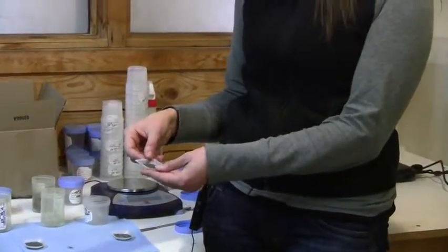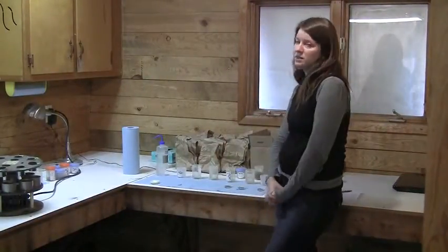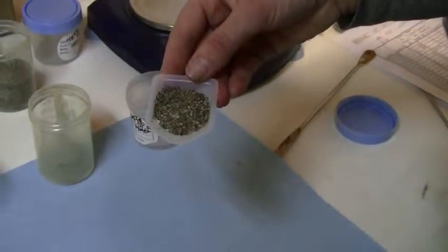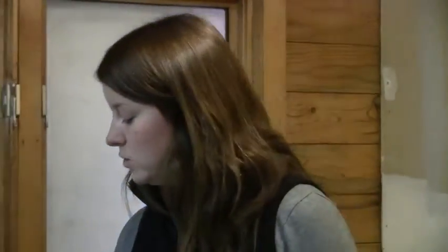Then we add a dispersing agent and mix that in with the soil sample, which will declump the stable aggregates that are bound together. We take that unclumped material, wash it through this same size sieve, and dry it, and what we have left over is just the coarse material that was in the original soil sample. In the end, we subtract this coarse material from the original amount of soil, and use the amount of stable aggregates plus coarse material to calculate the percentage of aggregate stability in our soil.